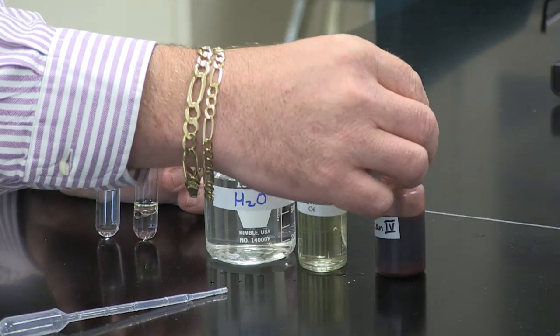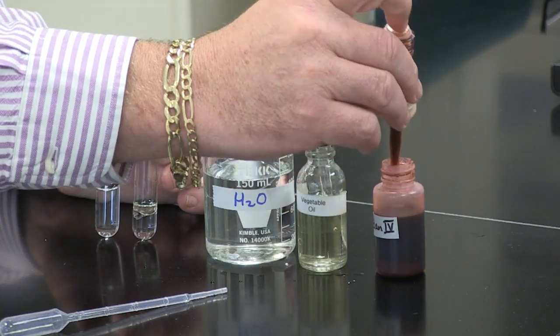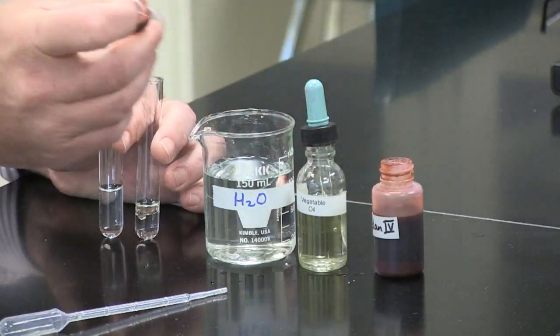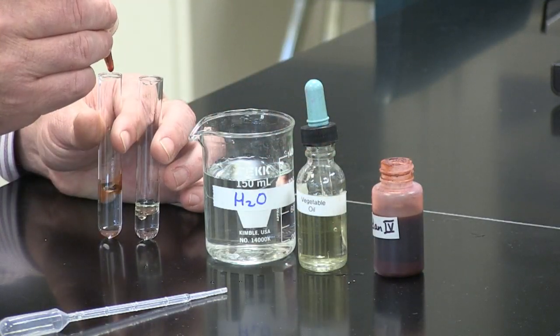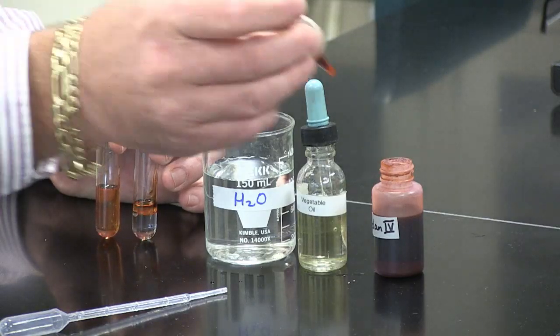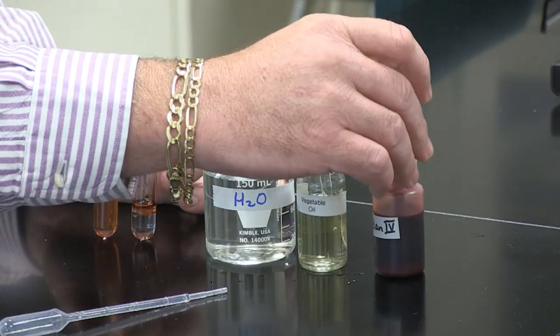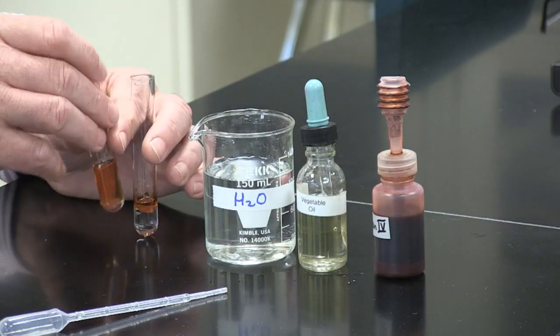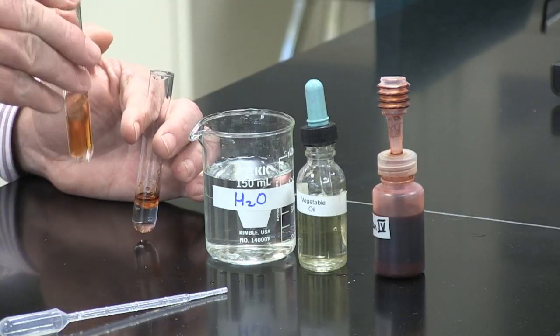Next, we'll add Sudan 4, which is the indicator for lipids. We'll put two drops into each test tube and we'll shake.